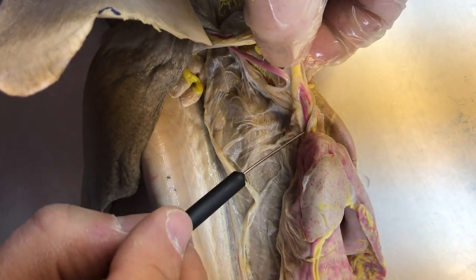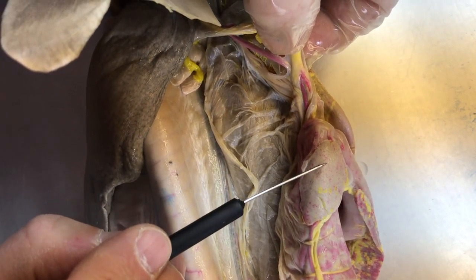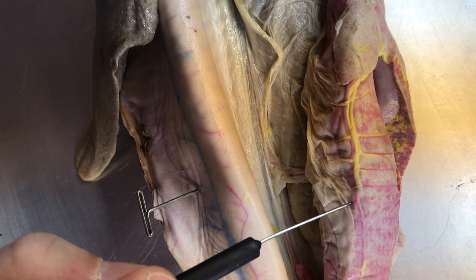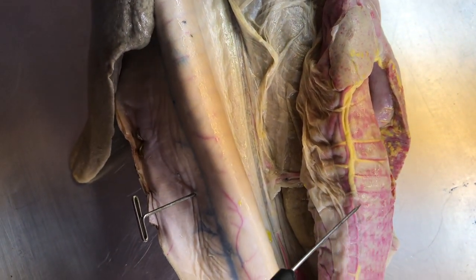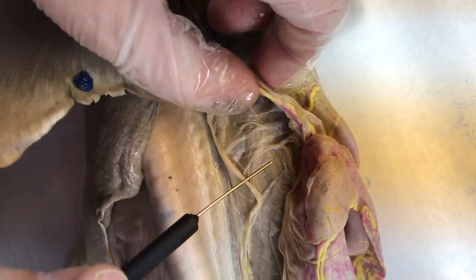This will run towards the duodenum. A branch goes off to the duodenum, a branch goes off to the pancreas, and then it continues as the anterior intestinal artery. And from here we have the annular arteries. These wrap around the ileum. Okay, so that's the first branch, the pancreatomesenteric coming off of the celiac.